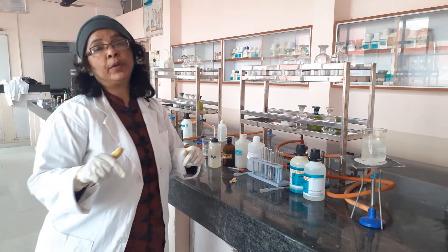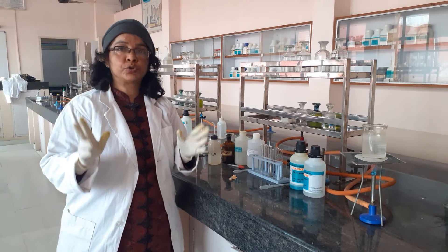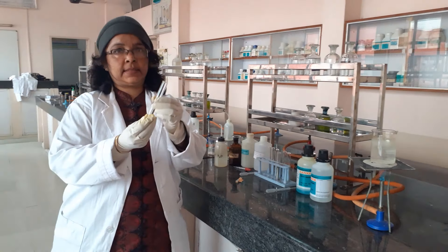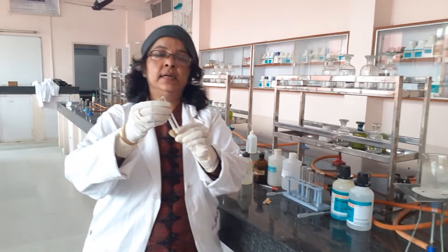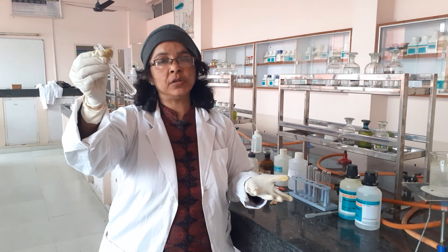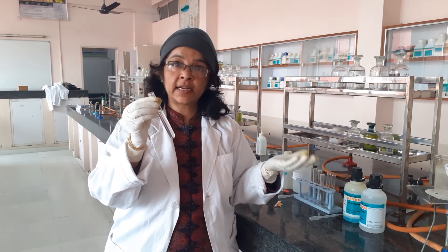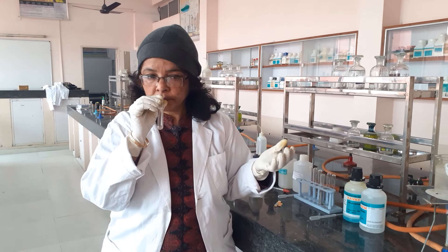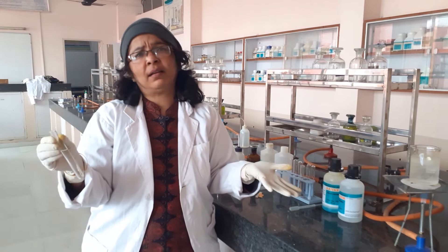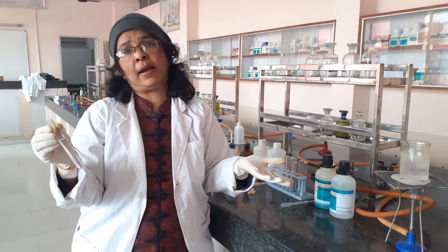I will be doing both tests in front of you and preparing the solutions as well. The sample given to me is this. Since it is a colorless liquid, that is what you would mention as the first physical observation. Moving on to the second observation — the odor. There is no specific odor, so you can write 'no characteristic odor.' You cannot identify the compound by this.